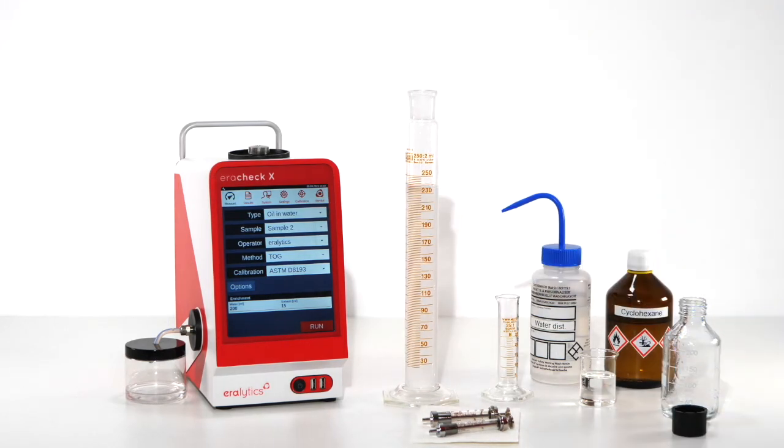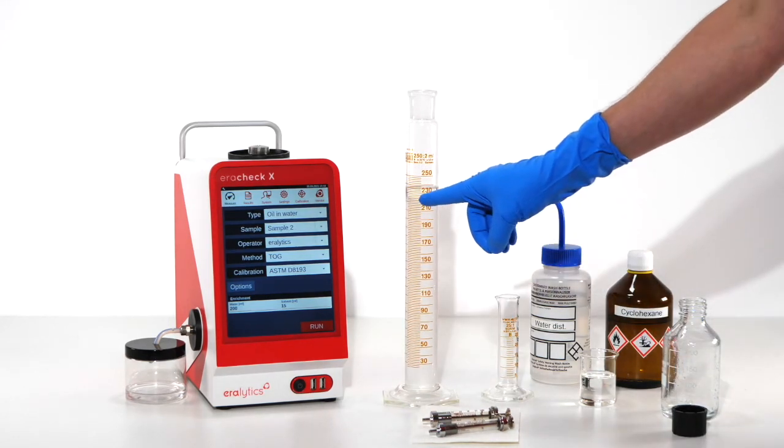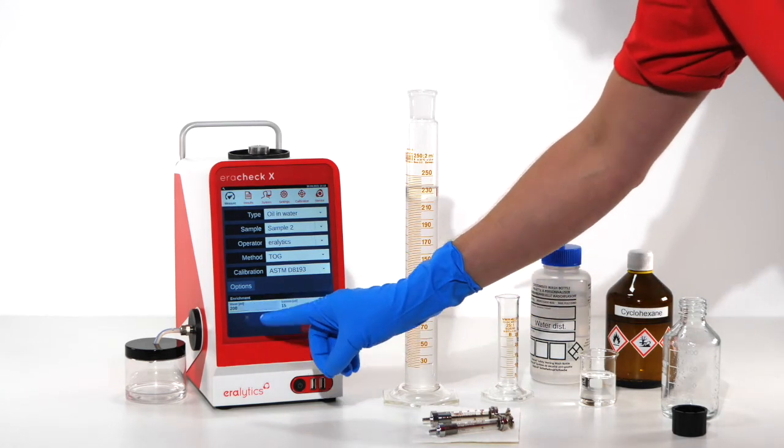As soon as the phase separation is completed, note the volume of the aqueous phase and enter it on the screen.